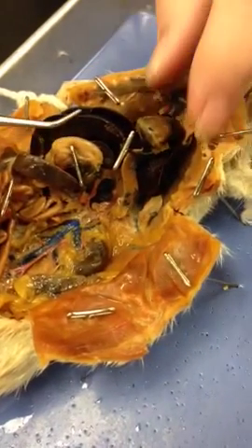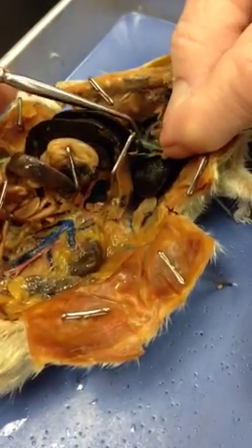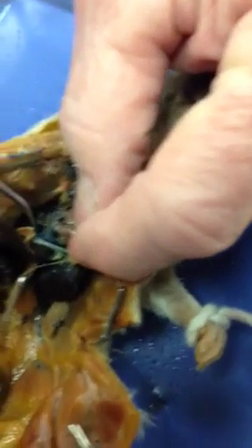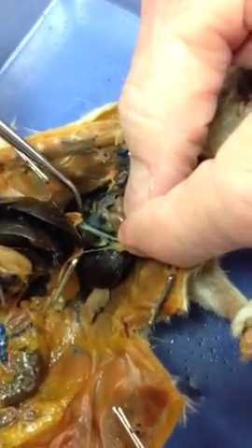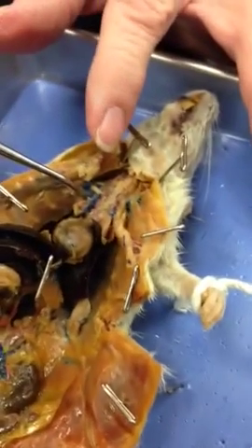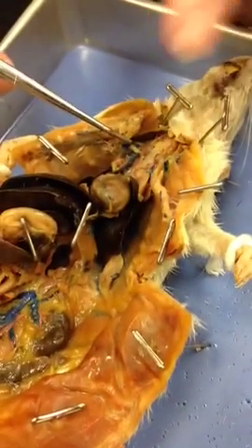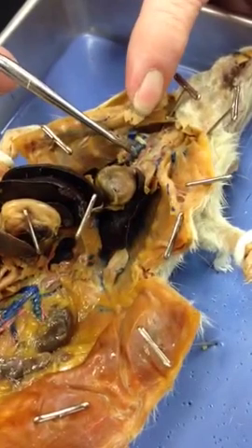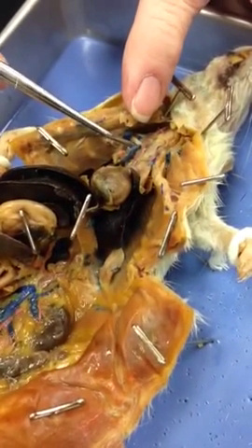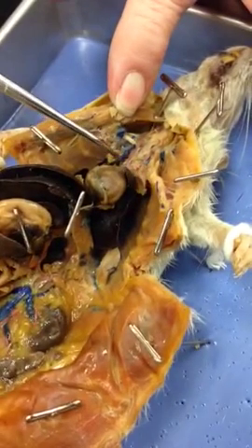But if we move the heart, you can see that inferior or posterior vein coming up to the heart. Now, they differ from us here with the anterior vena cava or superior vena cava. We have one. They have two. So that's what those are.